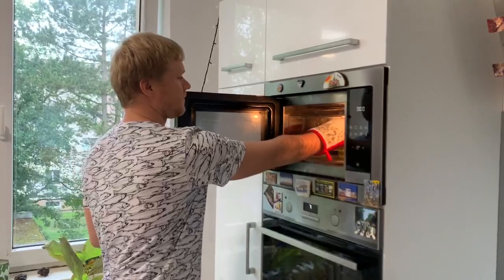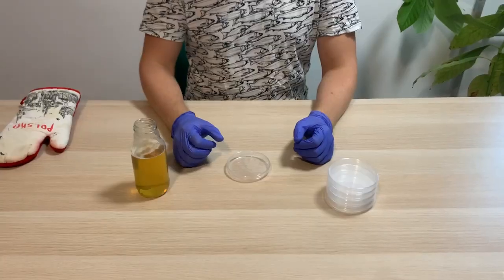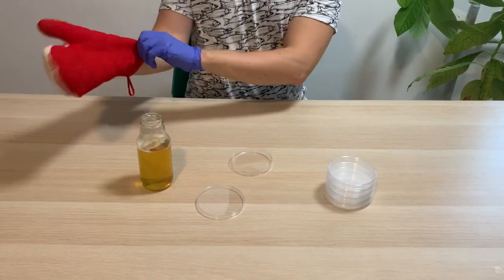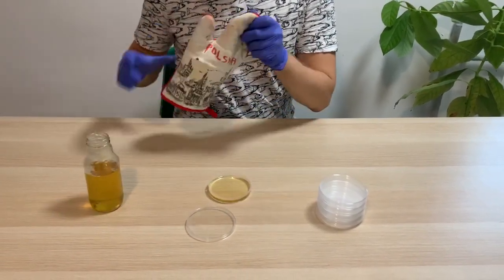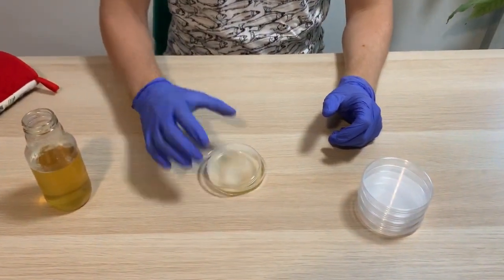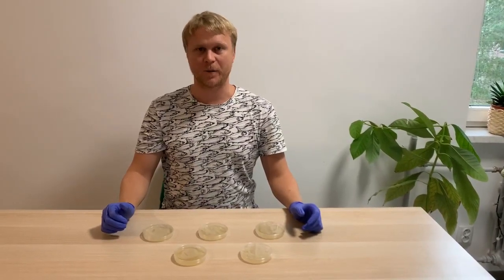Place the bottle without a cover in a microwave and heat it at 700 watts for three minutes. The solution will start boiling. If the solution is yellow and transparent, as you can see here, let it cool down on a table for three to five minutes. Remove the lid of the petri dishes and put it on a clean table. After that, fill the petri dishes half full with warm agar solution. Do not completely close the lid; rather cover it from one side to allow evaporation. Repeat the procedure with all available petri dishes. The media will solidify in approximately one hour and agar plates are ready.